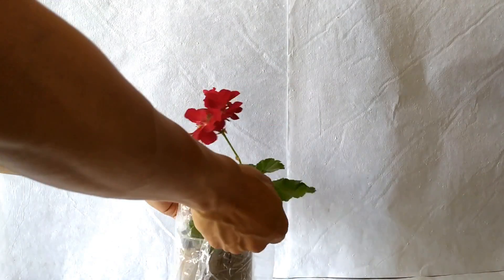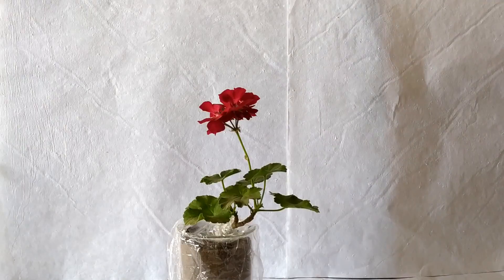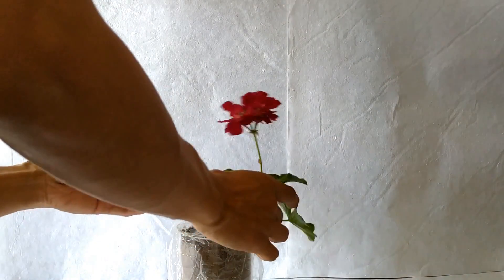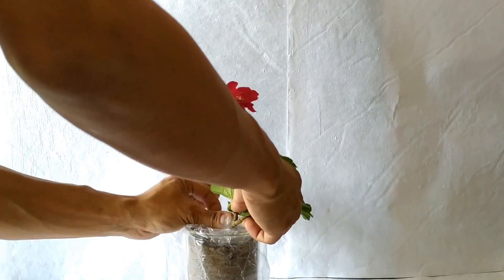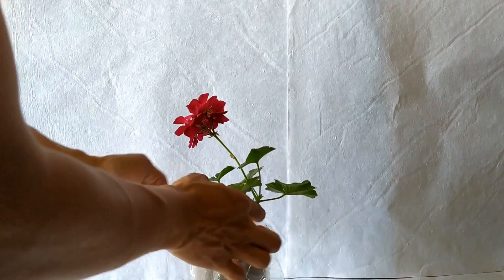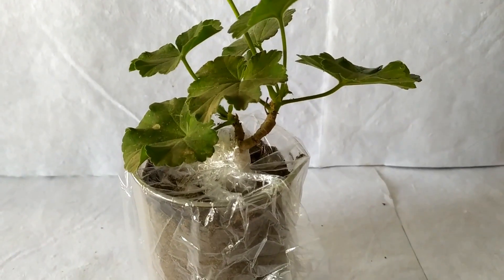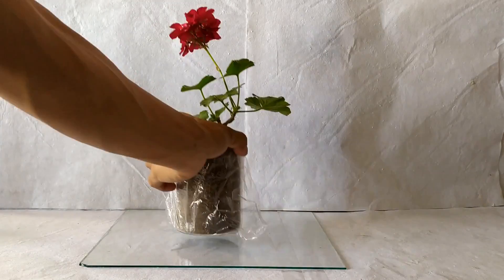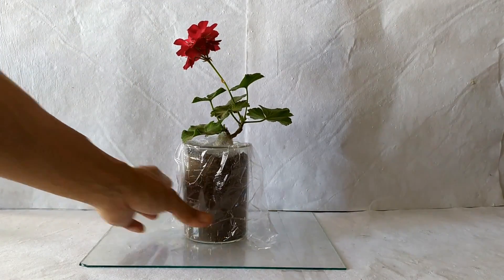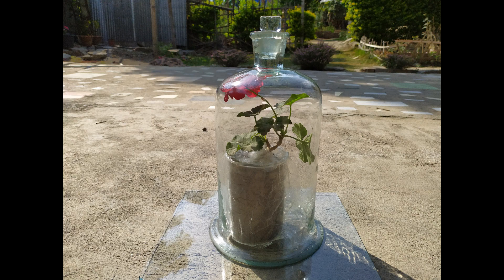For the bell jar method, take a potted plant and cover the pot and the soil in the pot using a plastic bag. Seal the opening of the bag around the base of the plant stem using sticky tape. Put the potted plant on the glass plate and cover it with a bell jar. Leave the setup in sunlight for a few hours.